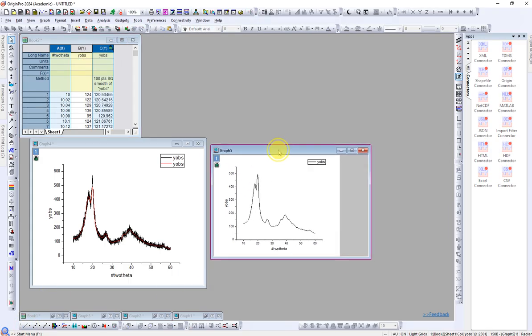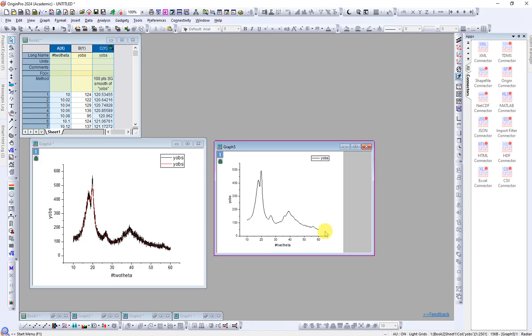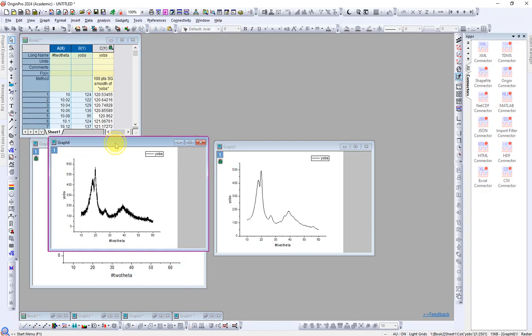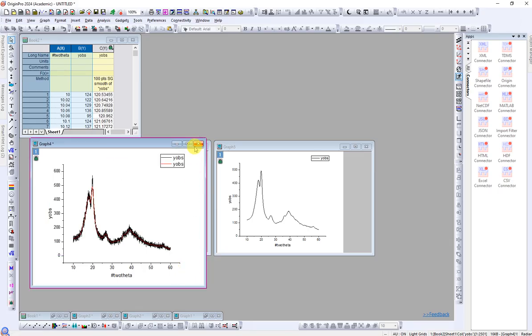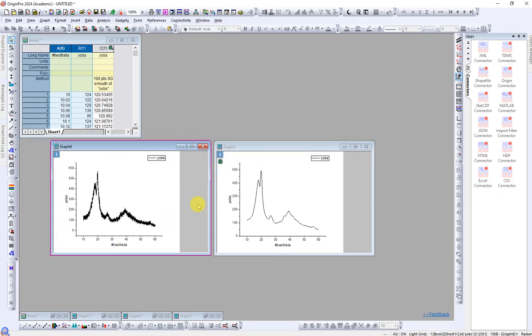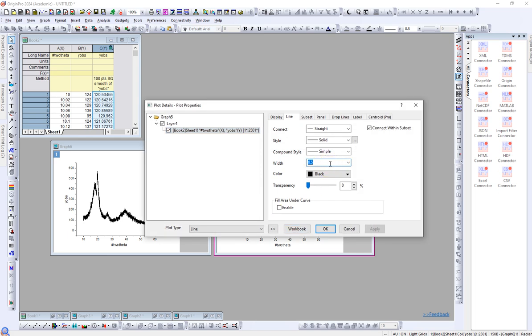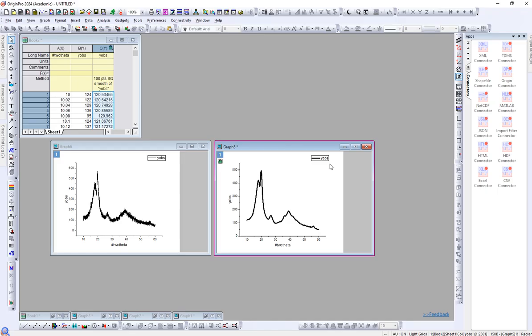Perfect. Now you can see the graph is pretty smooth. It's not like the raw data. This is the raw data. Yeah. So you can see the graph has changed from this a lot of noise to a very smooth graph. So let's increase its width. Yeah. So this is the way how we smooth the graph.